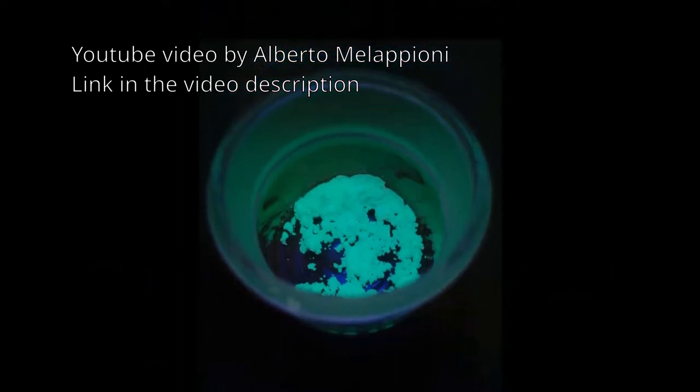It is actually a naturally occurring mineral that can act as a green phosphorescent material, but it can also be made synthetically.